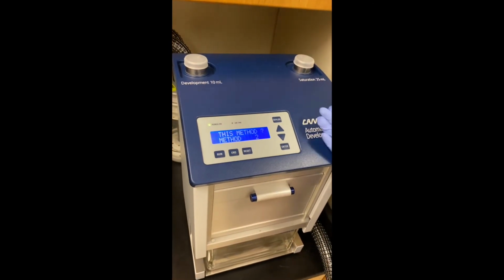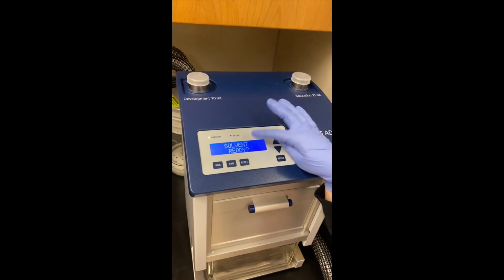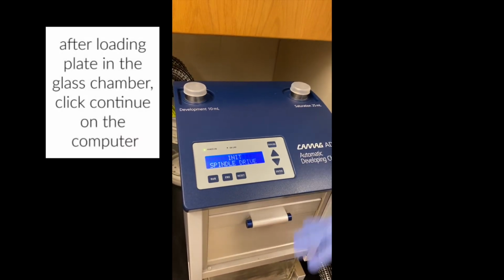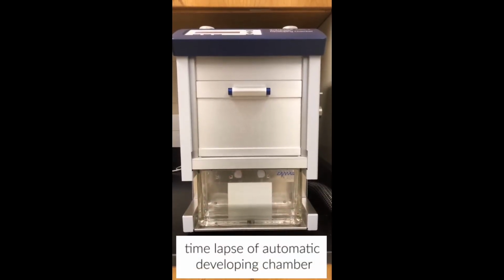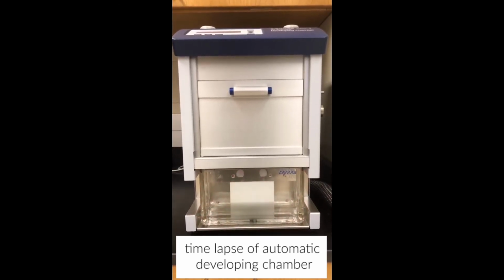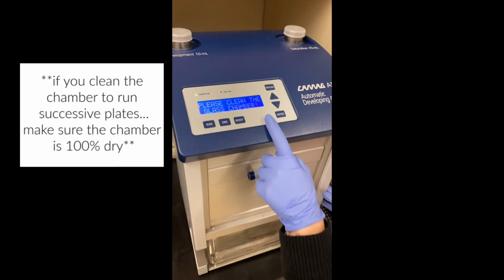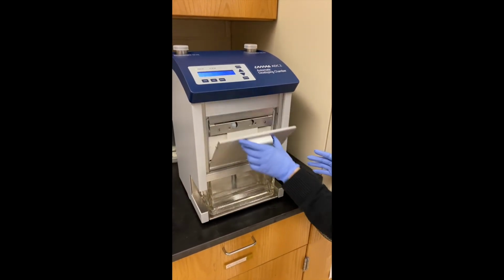So once you have selected the method that you want to use, choose enter, and then it will ask you if the solvent is ready, and then you can just say yes, it's ready, then enter. Then it will start. Once this is done, you can see that it says clean the glass chamber. But we're not gonna clean it right now. We're gonna take the plate out.